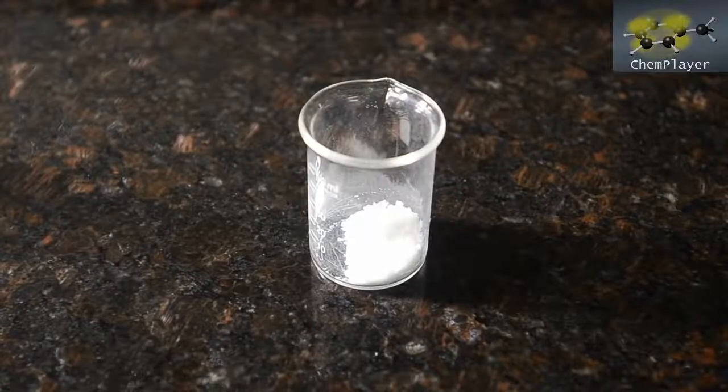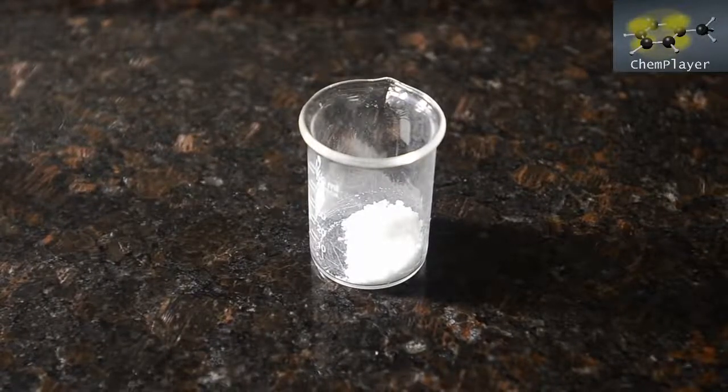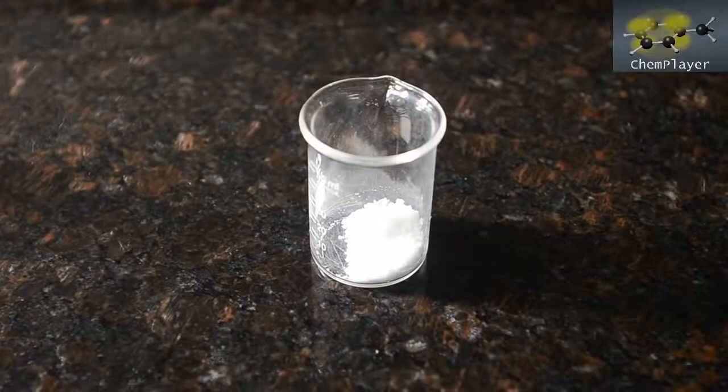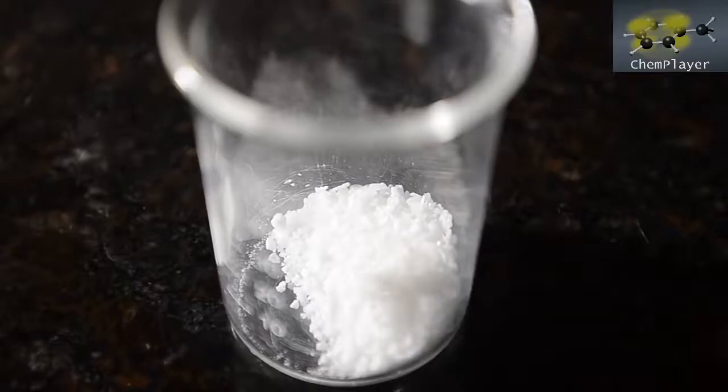Paracetamol is pretty cheap and commonly available, so we'll perhaps also try and see if it can be hydrolyzed using dilute acid as well as alkali at some point in the future to see if this is also a cleaner method. So stay tuned for more reactions and to see what we've got planned with our p-aminophenol product.